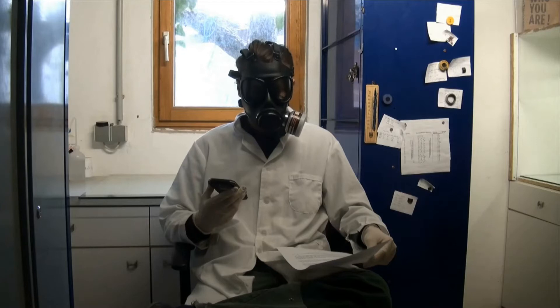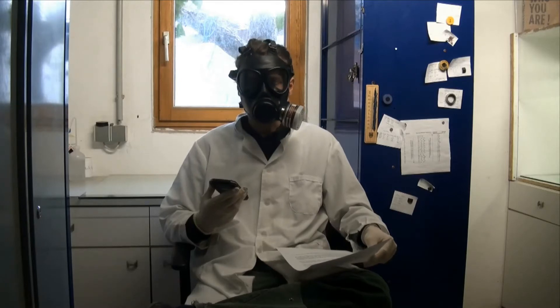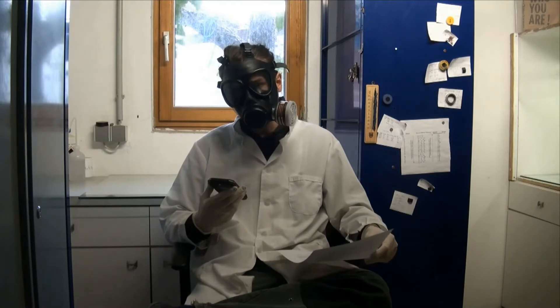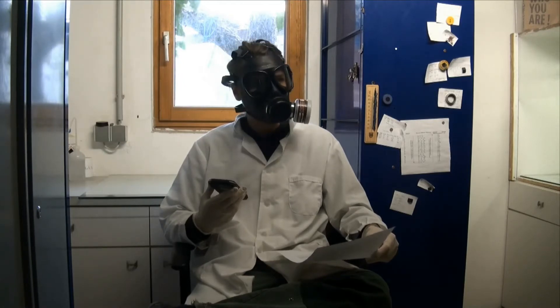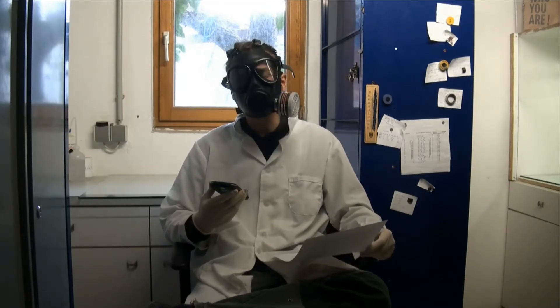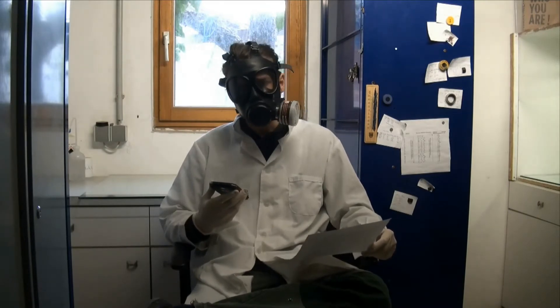In my last video I prepared nitric acid from phosphoric acid and nitrate salt. This only yielded low concentrated nitric acid with a concentration of about 44%.